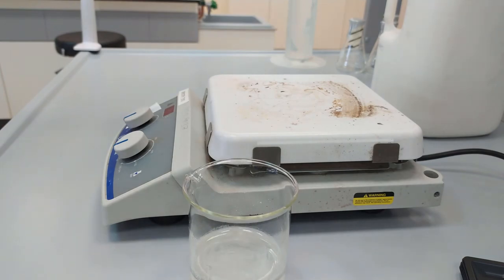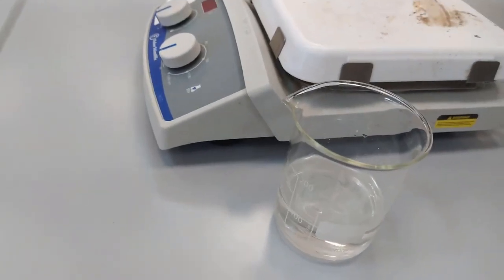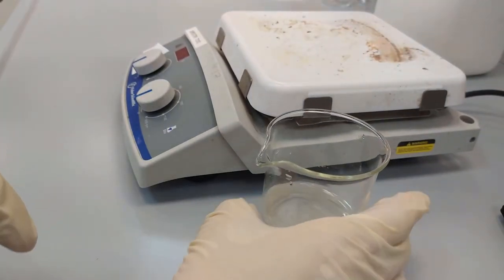And your 1.2 molar concentrated solution is ready. So as you can see we have 100 milliliters now.